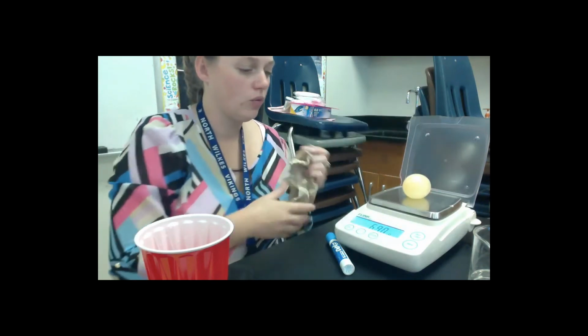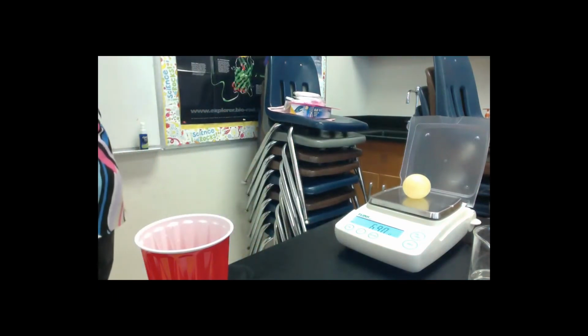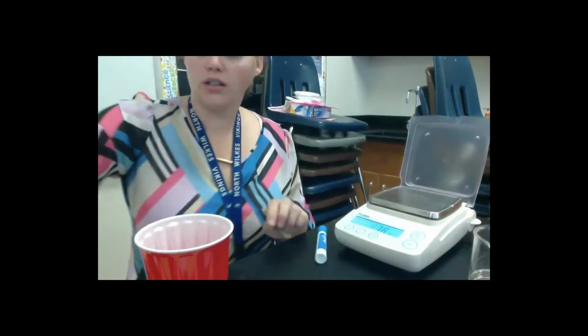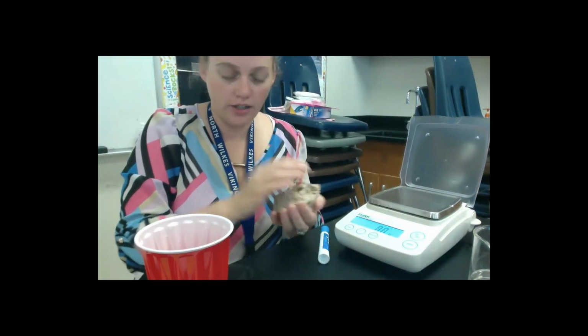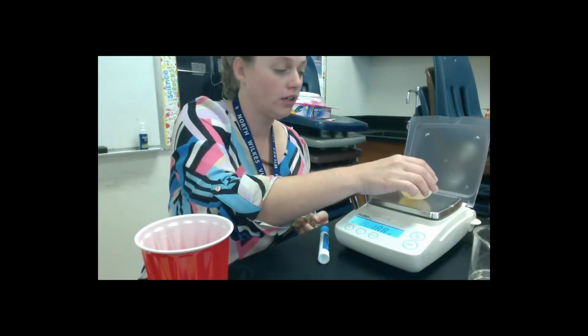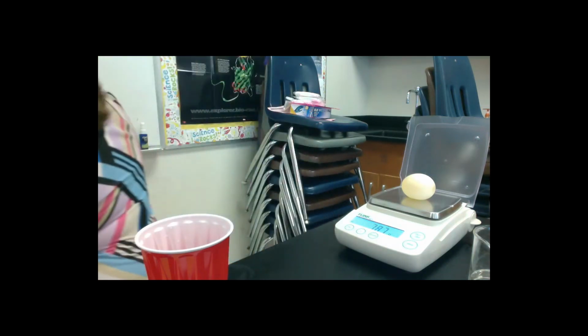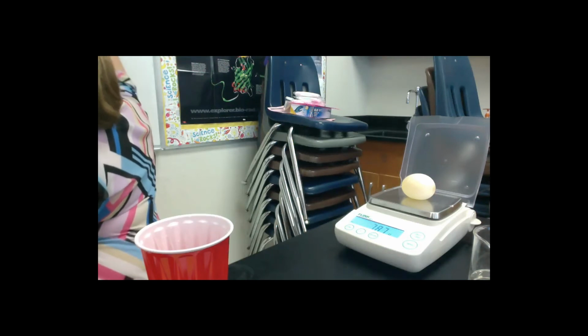And my water egg weighs 69 grams. So I'm going to go ahead and record that on the whiteboard. All right. Now I'm drying the egg that I've designated to go in syrup. Again, want to make sure that I weigh the egg, not the water on the egg. And it weighs 78.8 grams. It seems to be going back and forth between those two. So, well, it's settled on 78.7. So the syrup egg, 78.7 grams.